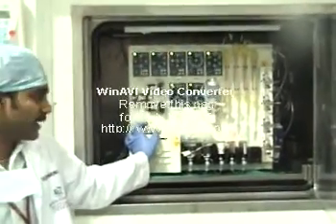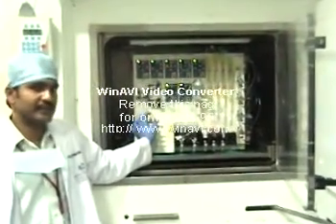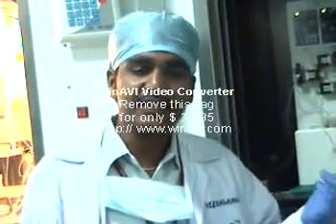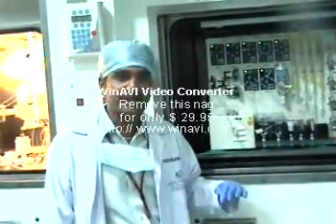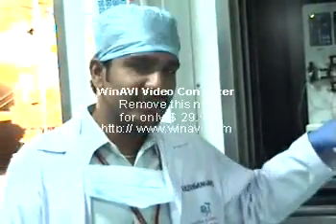Once the F-18 fluoride reaches the reaction vessel, the real synthesis begins. A couple of evaporation steps take place. In the first evaporation, water is boiled to the maximum extent at certain temperatures. However, some residual water remains, so we use a process called azeotropic distillation. We cannot boil all the water by heating extensively because it would lead to decomposition of the fluorodeoxyglucose and very low yield. During azeotropic distillation, we boil water at lower temperatures — the boiling point of water is normally 100°C, but we need to boil it at around 80°C. To achieve this, we add acetonitrile to the water, which brings the boiling point of the water-acetonitrile azeotrope down to 81.6°C.